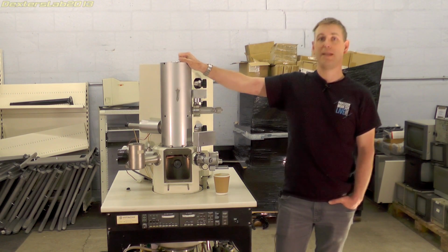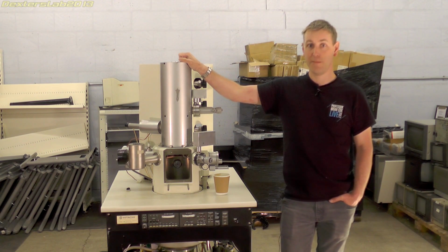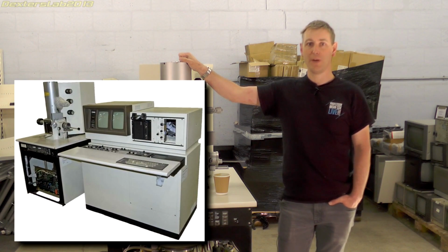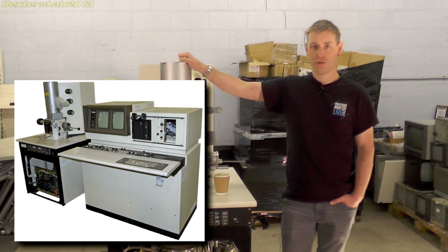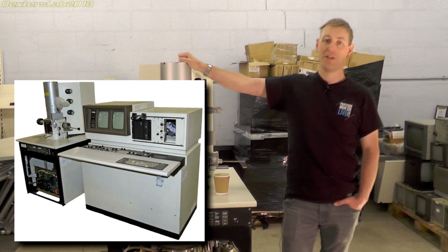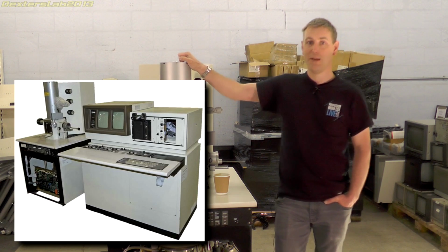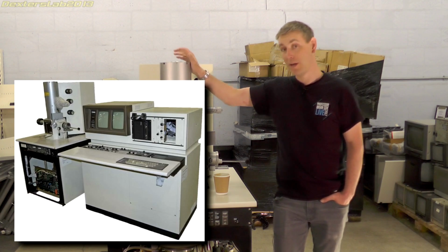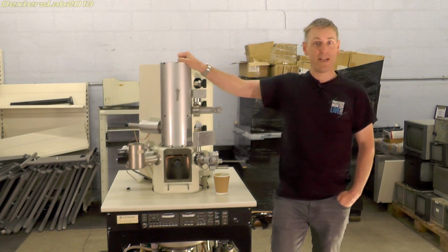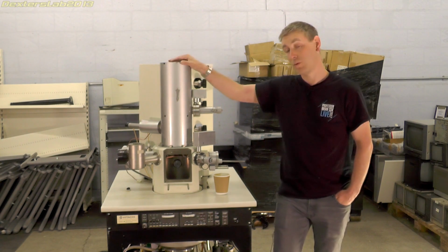Now, as I said, this is missing quite a bit. The biggest, most notable thing is the main control desk and console. This contained the viewing monitors and the operator controls, displays and the control electronics, part of the vacuum and high voltage generation system. But sadly, it was scrapped before I bought this part, so we have only this bit remaining. And that renders this part pretty much useless, and to be honest, this could well have faults.